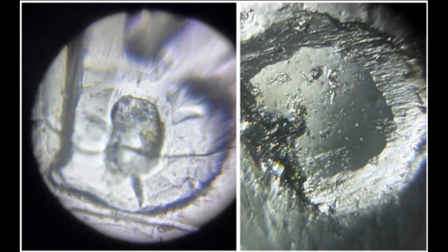apply a layer of nail polish to the object, let it dry completely, peel it off, and place the impression on a slide. This technique is great for studying leaf stomata and veins and for examining the tiny minute details in fossils.